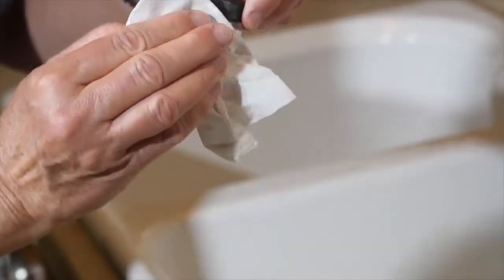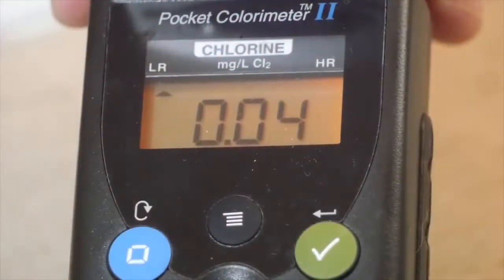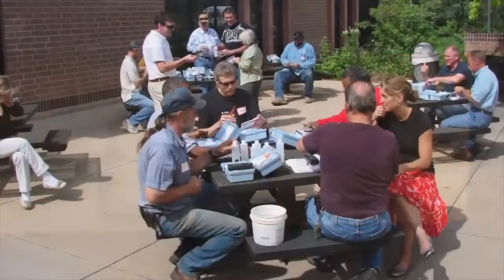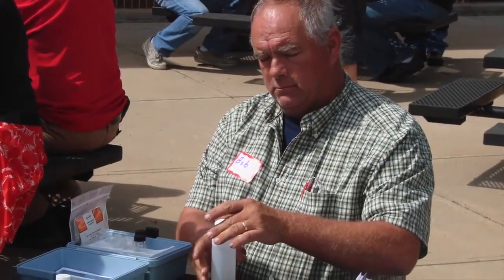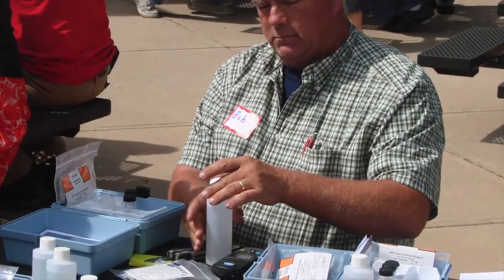So make sure that you wipe off the vial with a clean, lint-free rag. Note that small interferences may be present. Just because the device has a number doesn't mean that chlorine is present. In our trainings using deionized water, no chlorine present, our students have noted residual concentrations ranging from 0.01 to 0.10 milligrams per liter. Recognizing this and identifying a reporting limit for your results is very important to ensure chlorine is present.